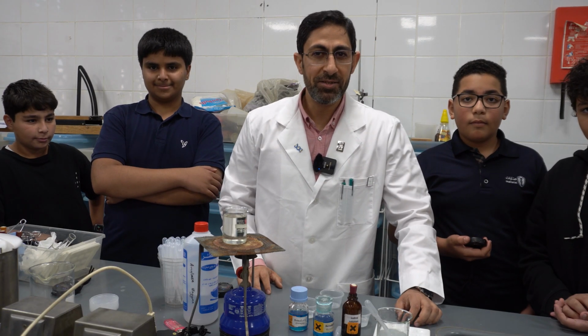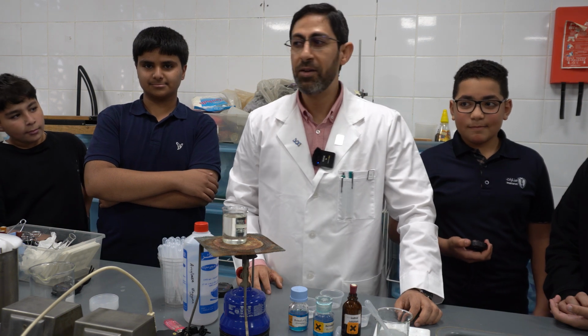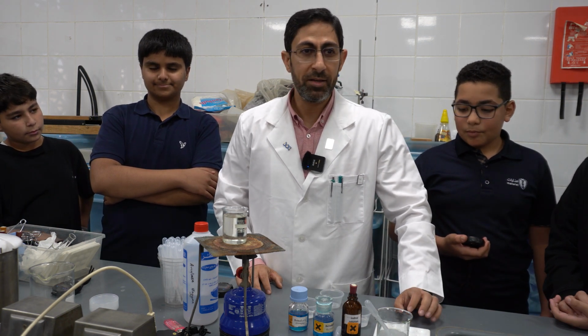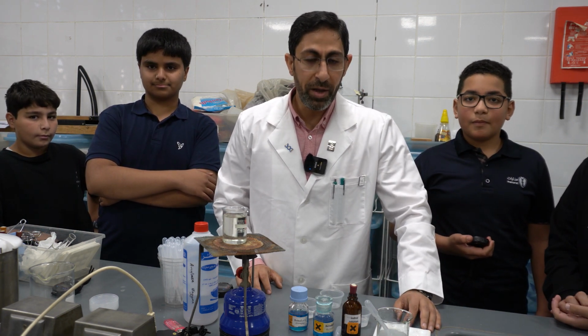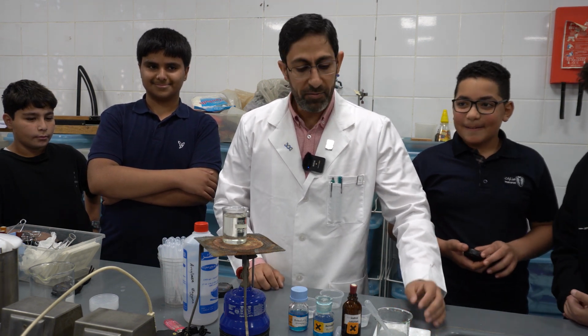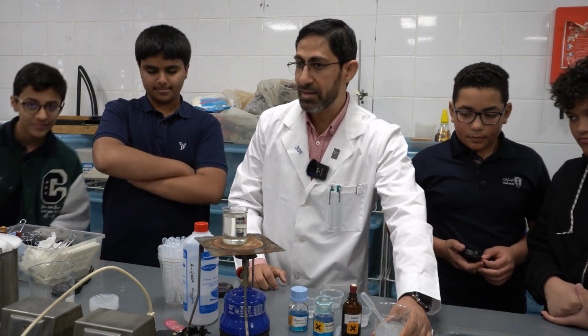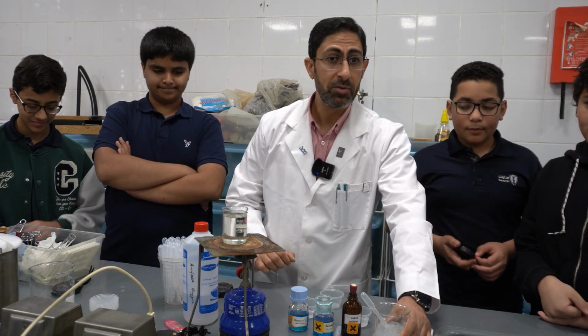Good morning, my students. Today we are introducing together the effect of the amylase enzyme on the starch. First of all, we have to test the presence of starch in the food. Here we have a food sample. We want to be sure that this food sample is starch.